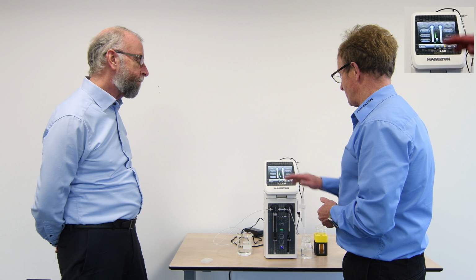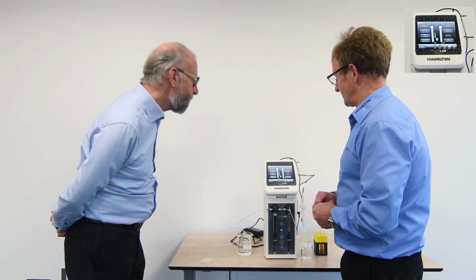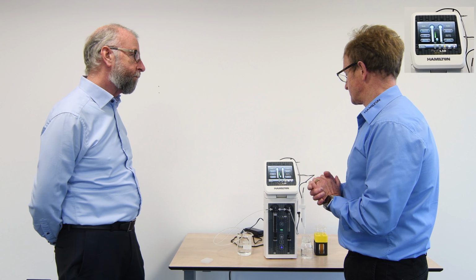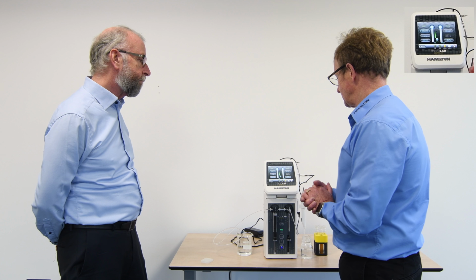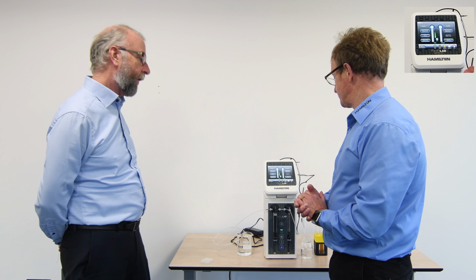That's a good point. Although we've only entered a few factors here, for example, the sample and the diluent volume, I understand what you're saying. Obviously, if you're repeating an assay quite a lot, it's easier to actually use a saved, or what we call a custom or favourites program.